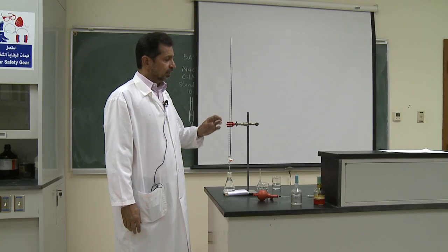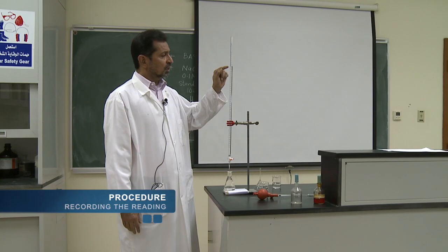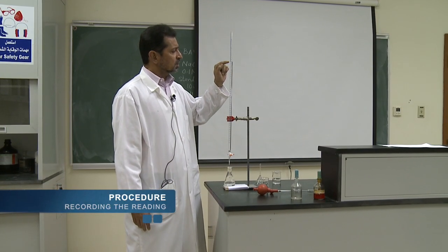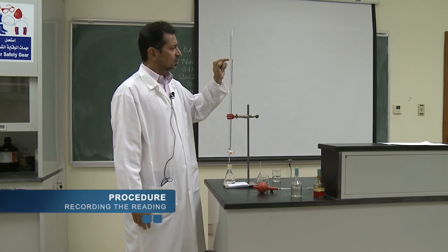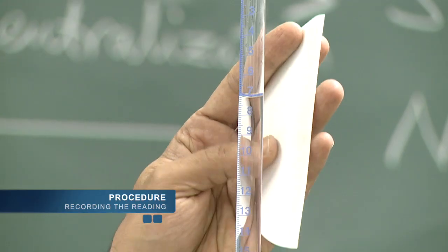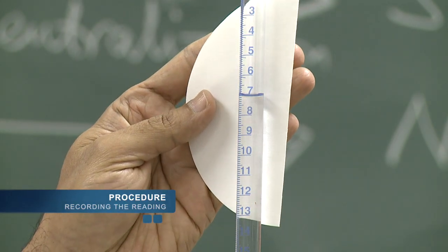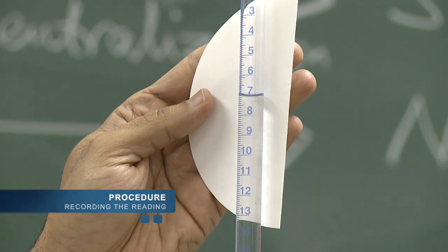After reaching the endpoint, observe the final reading by looking at the lower meniscus of the burette. The reading is exactly at 7 ml — that is our final reading. For convenience, keep a white paper on the back of the burette so you can see the reading clearly.